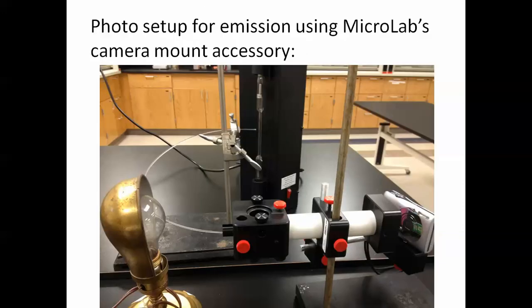Here's the setup that I have used. First of all, if you take a look at it, you can see the visual spectrometer right in the center. Behind it you have a helium lamp with a power supply for generating the light for calibration. We also have a source of light. In this case it's a tungsten filament lamp, but it could be any source. On the back side we have a digital camera and we have a diffraction grating.